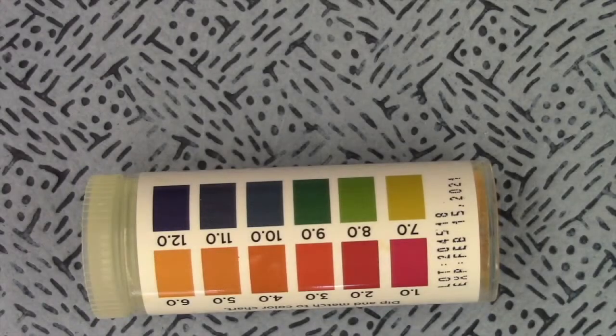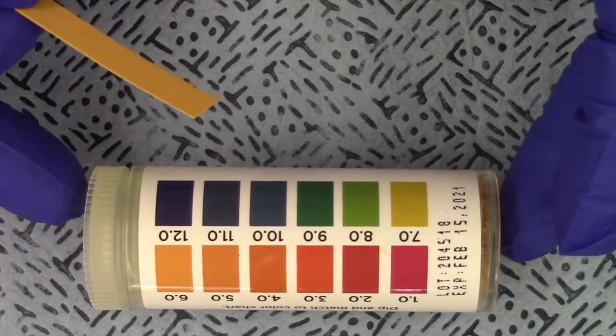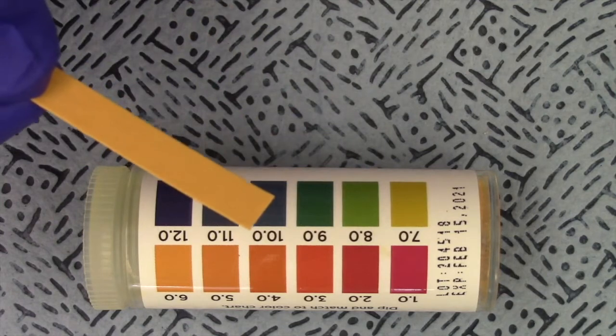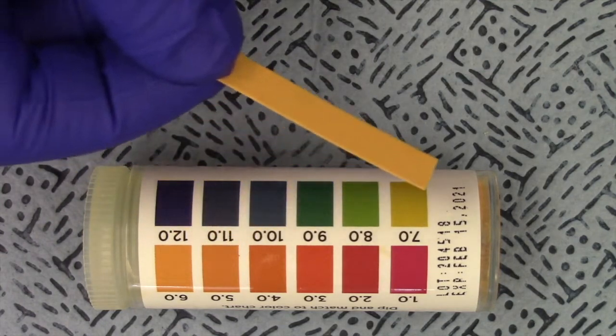All right, class, we're going to do part 1 of experiment 8, pH determination. We have a series of solutions we need to test, and we're going to use these little things called pH paper, just like this. Essentially, as we test each sample, this piece of paper is going to change color depending on the pH.